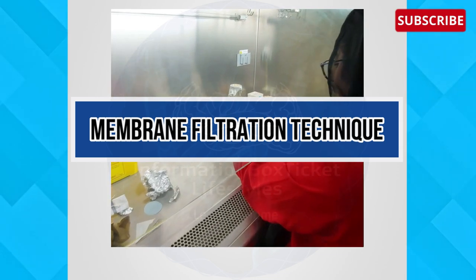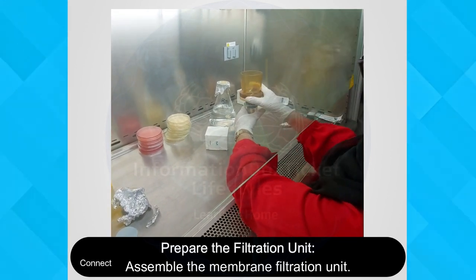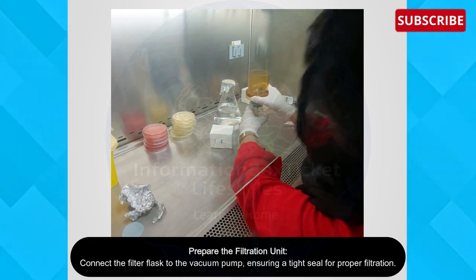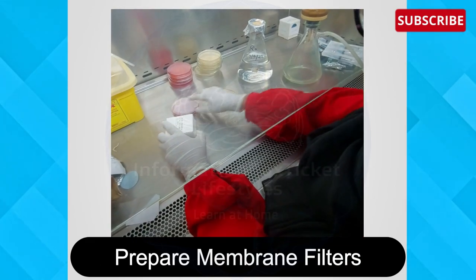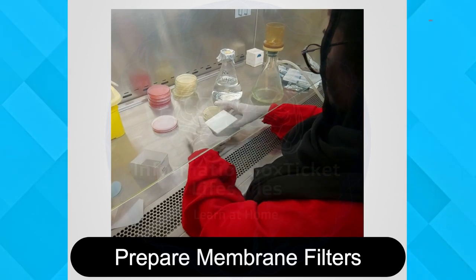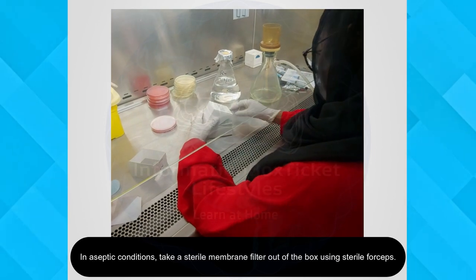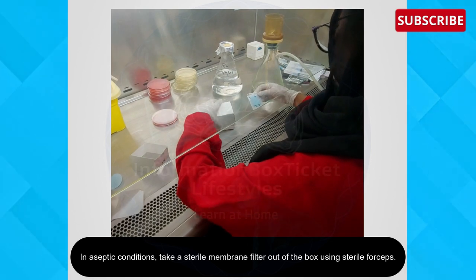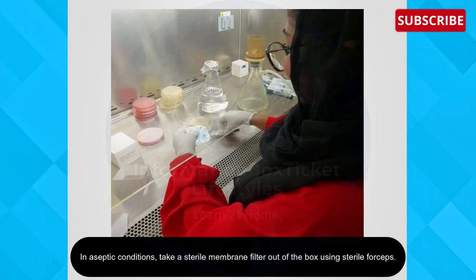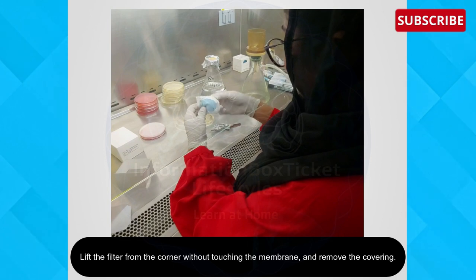Let's begin with the procedure of the membrane filtration technique. First, prepare the filtration unit — assemble the membrane filtration unit and connect the filter flask to the vacuum pump, ensuring a tight seal for proper filtration. Next, prepare membrane filters. In aseptic conditions, take a sterile membrane filter out of the box using sterile forceps. Lift the filter from the corner without touching the membrane and remove the covering.